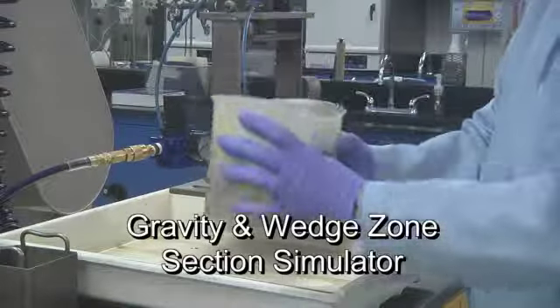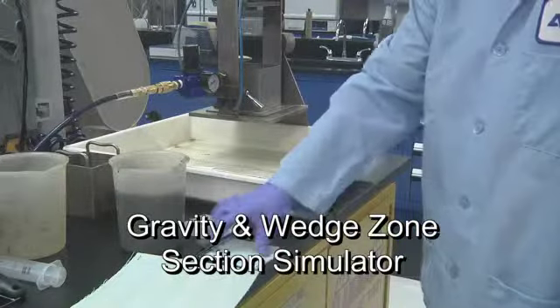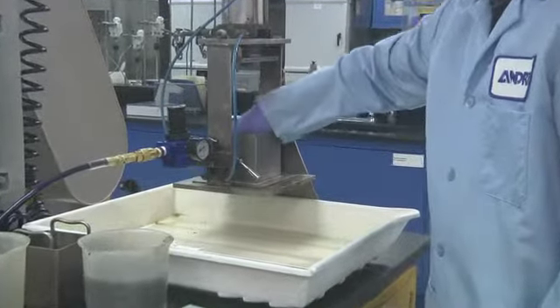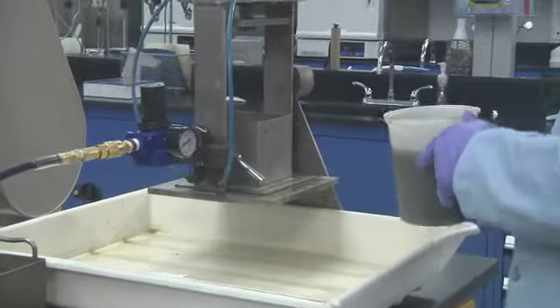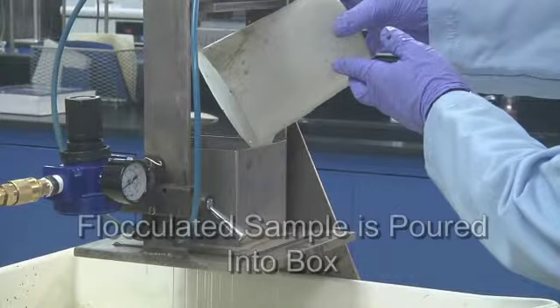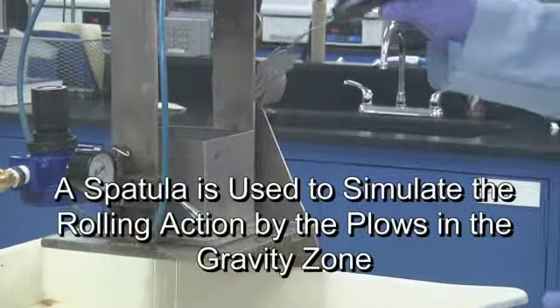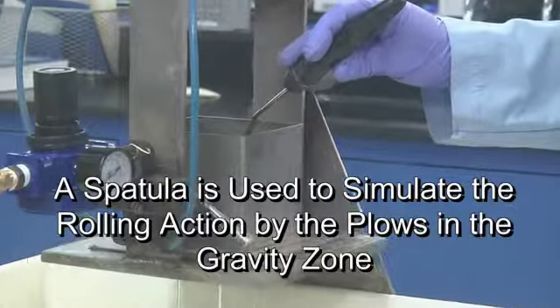After the test sample volume has been determined, it is appropriately flocculated and gravity drained in the wedge box. This is lined with a polyester filter fabric which conforms tightly to the shape of the box in order to retain the sludge solids. Flocculated sample is poured into box.